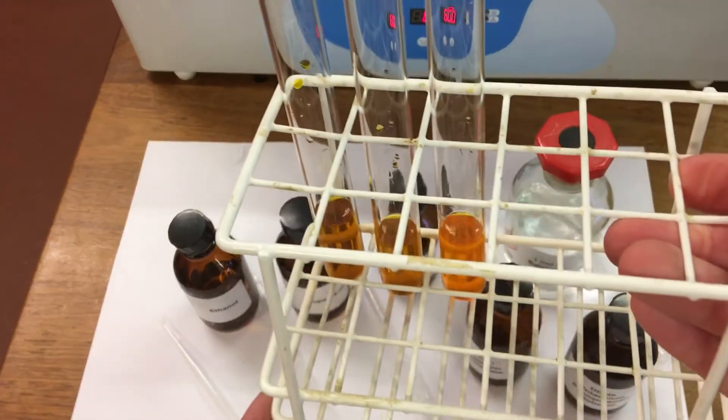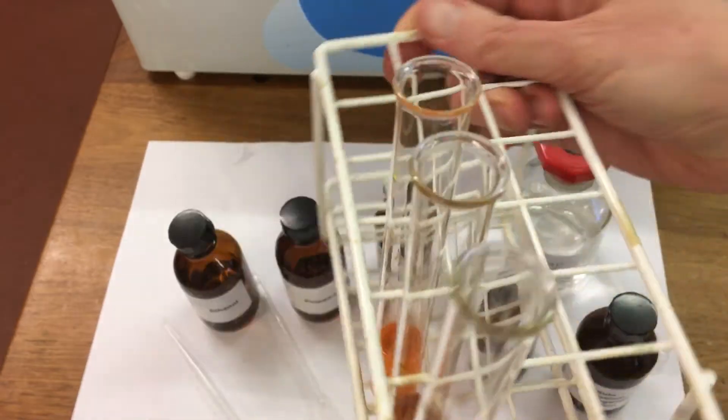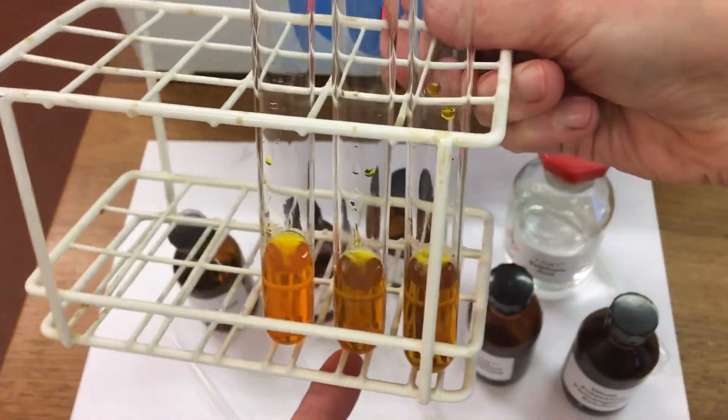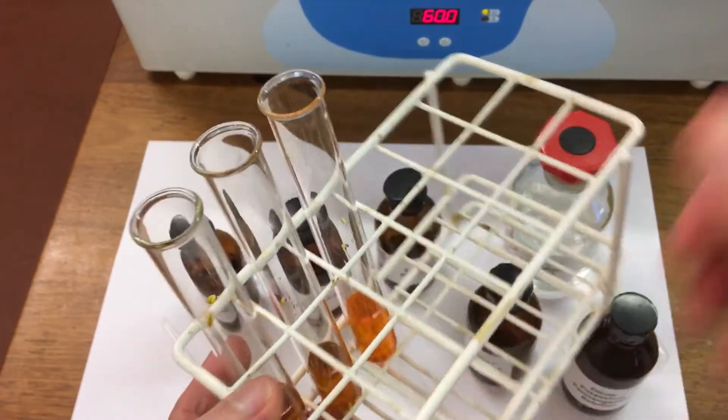And then we need to pop the test tubes in a water bath. So you can see the colors there. Pop the test tubes in a water bath.